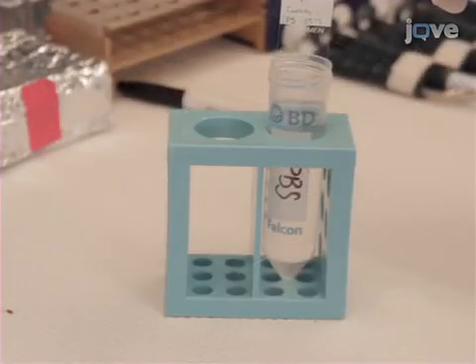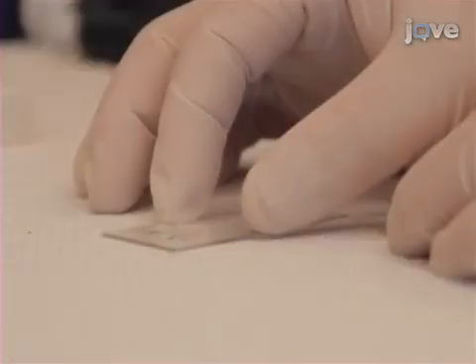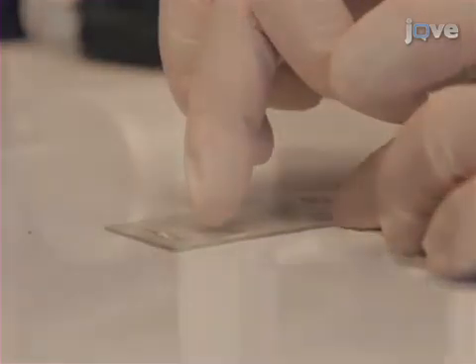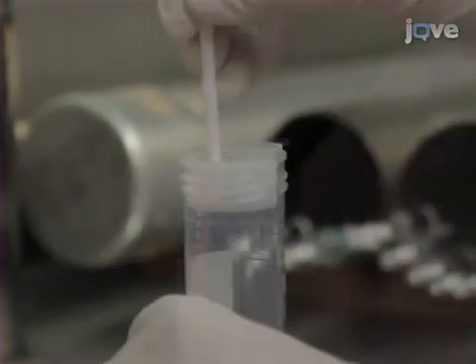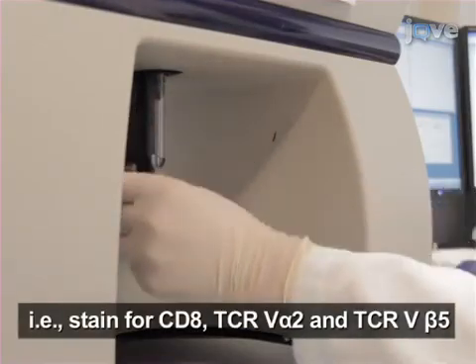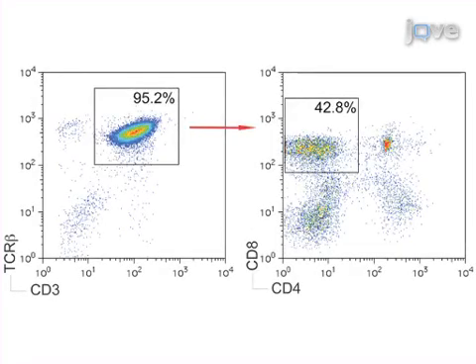At the end of incubation, wash the slides 3 times in cold PBS. Finally, mount the sections with a water-based mounting media before fluorescent microscopic examination. For flow cytometric analysis of tumor-infiltrating T cells, squash the tumor into a single-cell suspension. Then, analyze the cells for specific surface markers. CD3 and TCR-beta are used as markers of T cells.